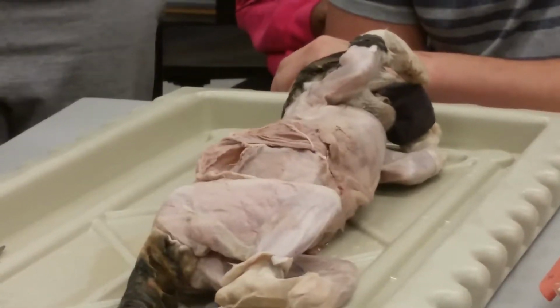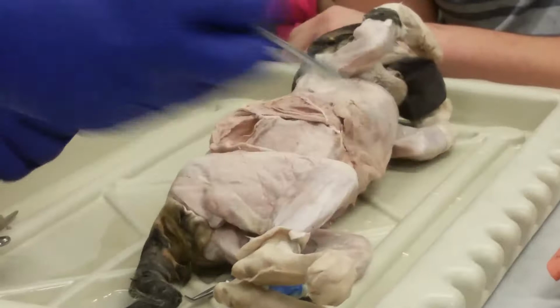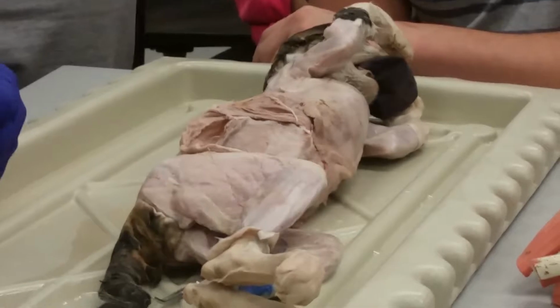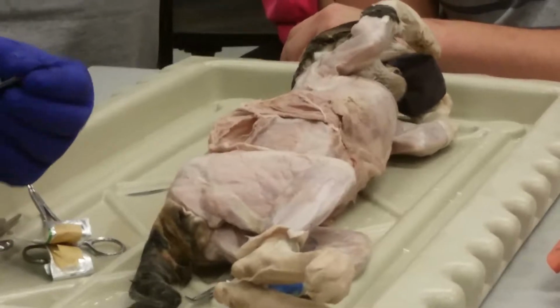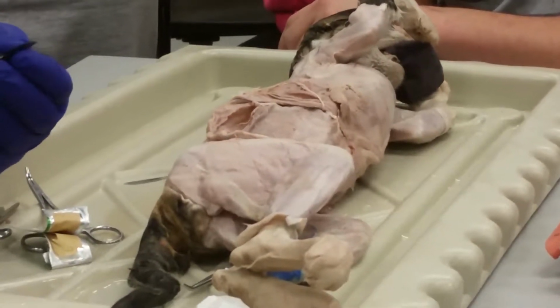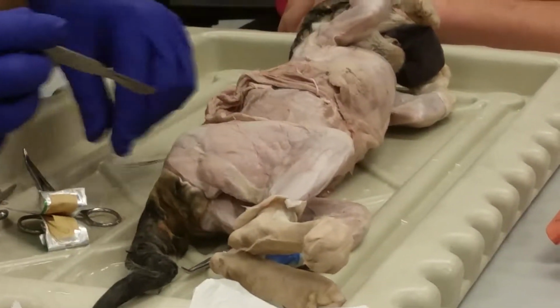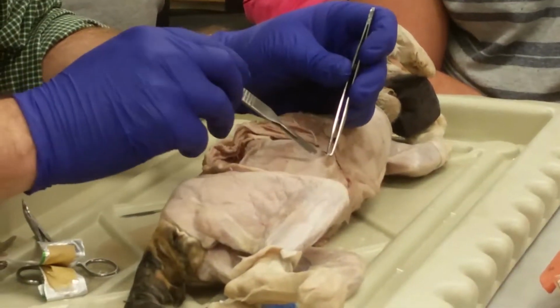These blades, you just stare at them wrong and get dull. Last thing I need to do is a trip to the hospital.